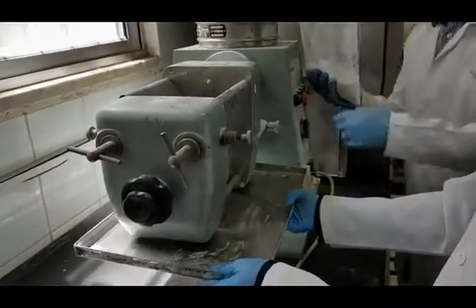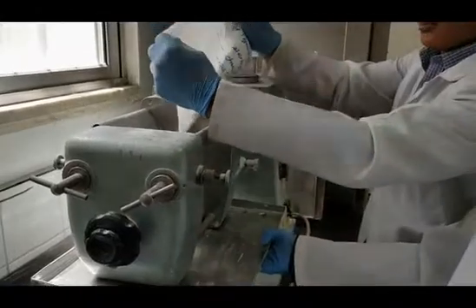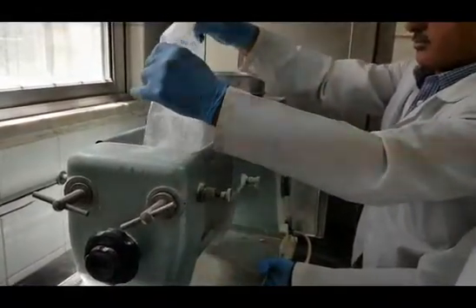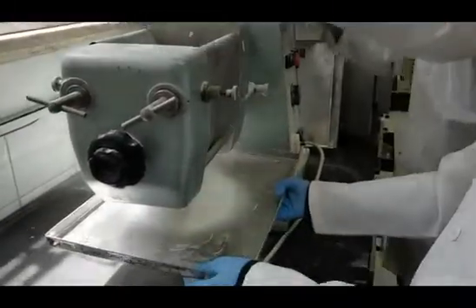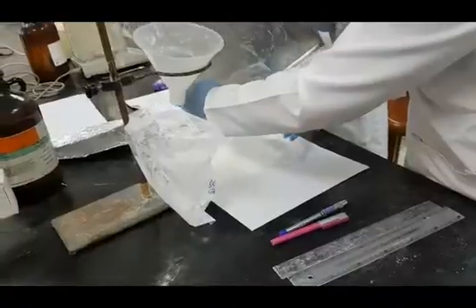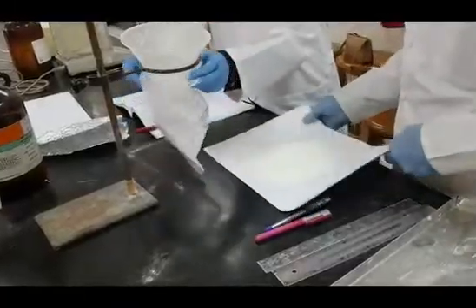To start your practical part, please regranulate granules B using the oscillating granulator and immediately return the granules to their container or plastic bag.